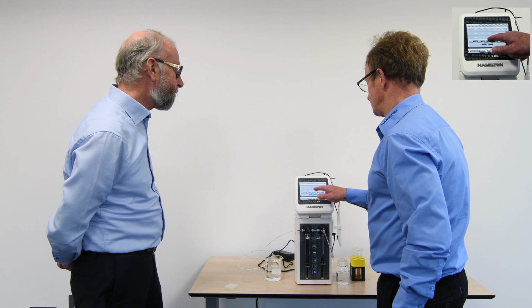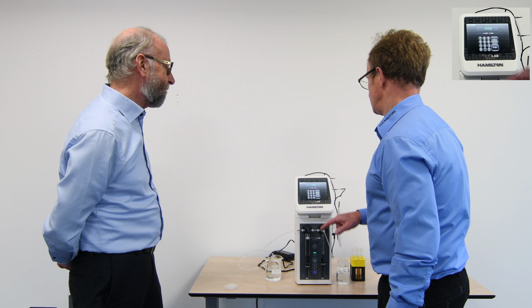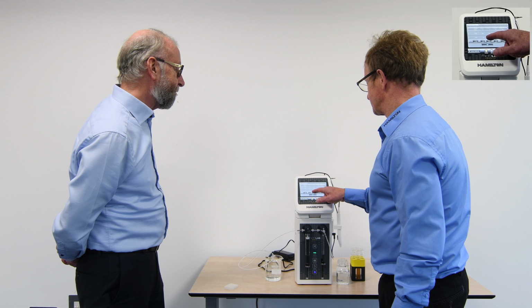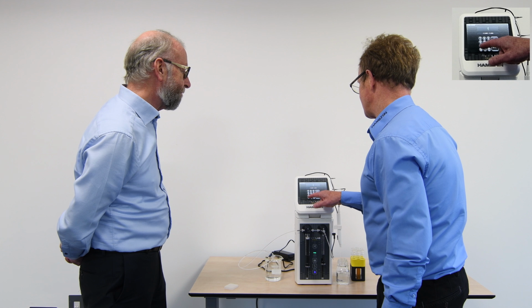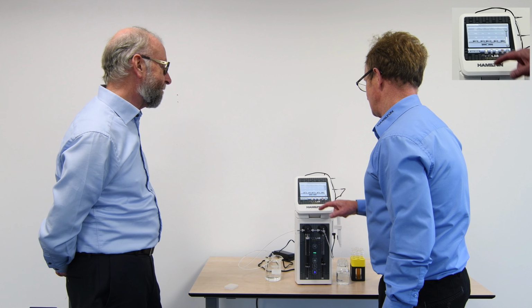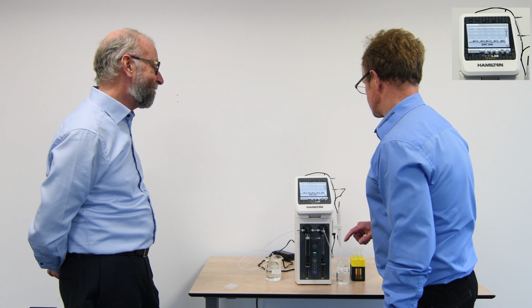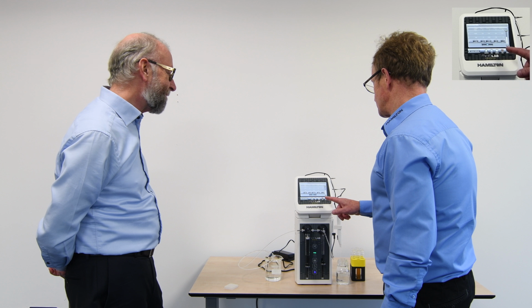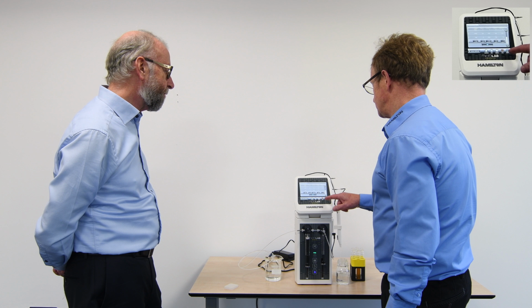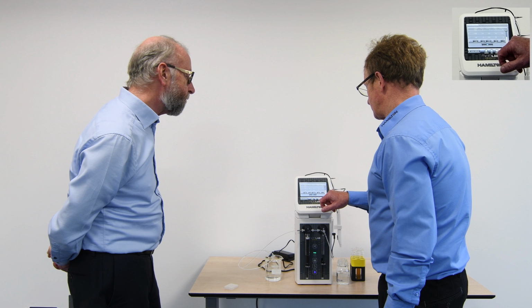So I can change this, and we put in our 5,000 microlitres, remembering that was in negative form. So I pick one, and you can see it'll change this to put in my 10,000 microlitres in the negative form. And now if I go to validate, it says the method is valid. In other words, the steps add up. Very good. Once that's actually in, we have the information stored. We have the ability to save and loop methods, so it's actually repeating those functions.